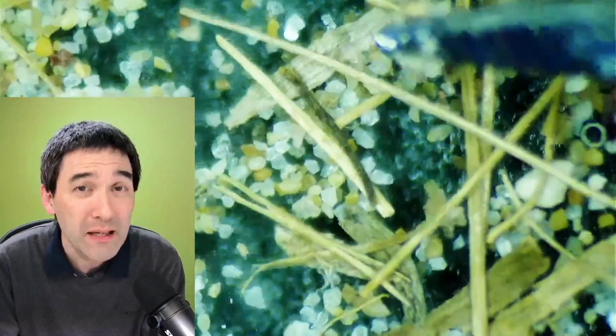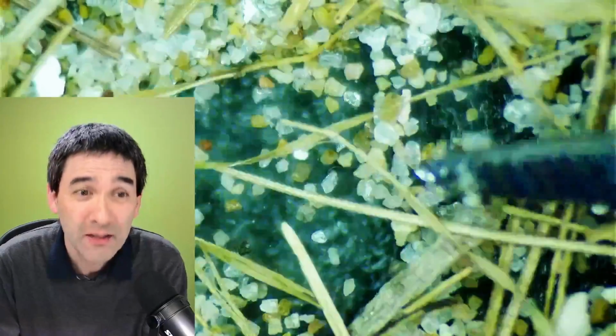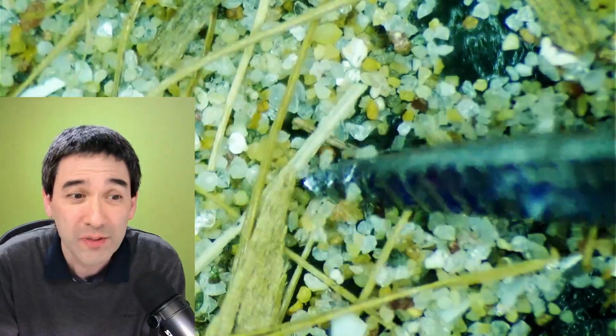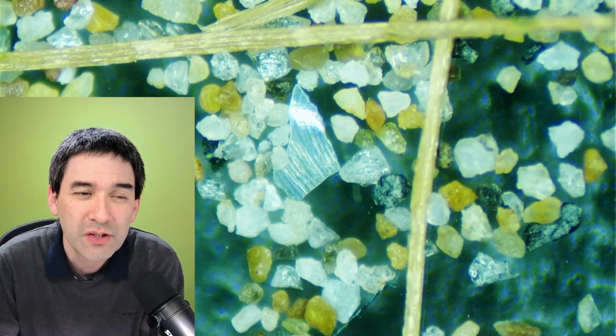But how did I find that out? Well, one of the things you have to know is that if you add acid, like for example fairly concentrated vinegar, to calcium carbonate, then it will make a chemical reaction and form carbon dioxide. So this was basically the plan. And so what I did is, under my stereo microscope, I put the sand sample, and I was looking for more of these small fragments. And indeed, it didn't take long. After a couple of minutes, I was able to find a few more of these. There was also plenty of other stuff in there, of course. But look, here it is, right? So I carefully picked it up.